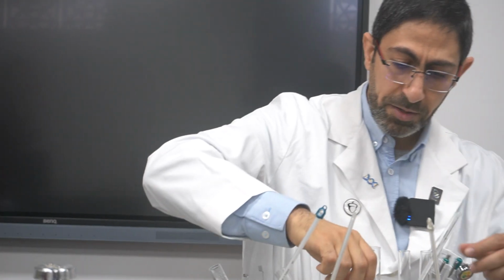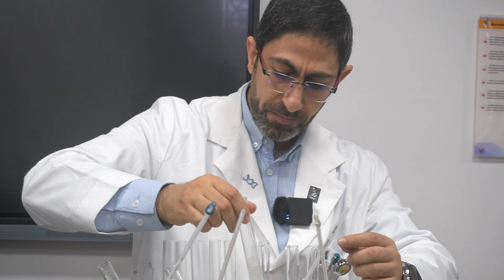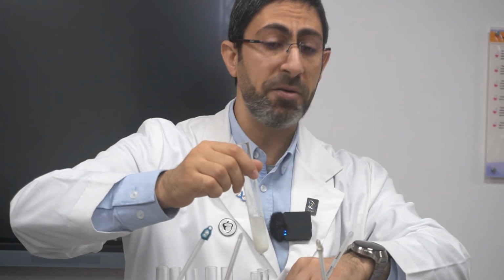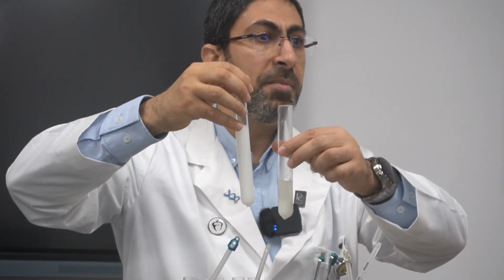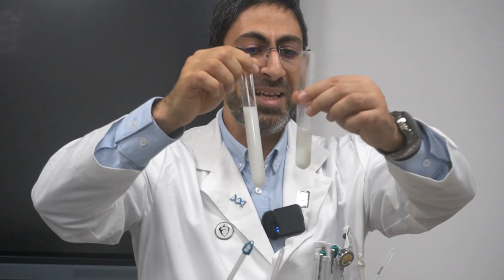It is still below the optimal temperature. Here is temperature 40, and we can see there's a huge difference between the reaction at temperature 40 and the reaction at temperature, for example, 60. Here it is totally unclear because the 60-degree temperature causes the enzyme to be denatured. So the enzyme is no longer effective, so no reaction will occur. But here it's easily seen.